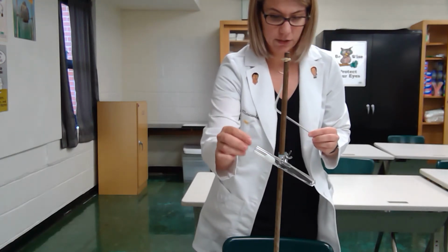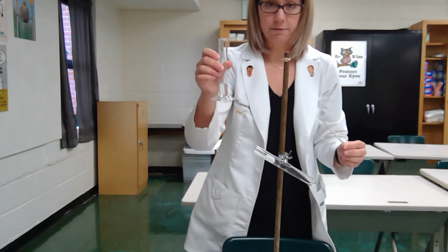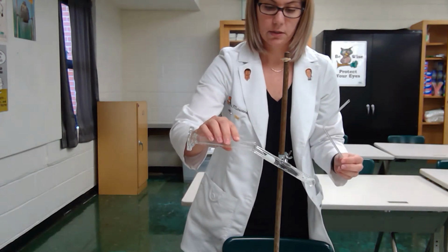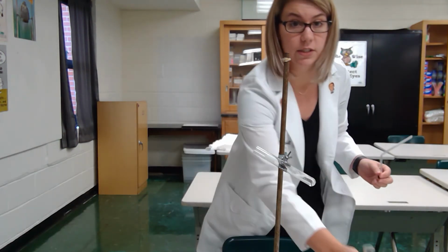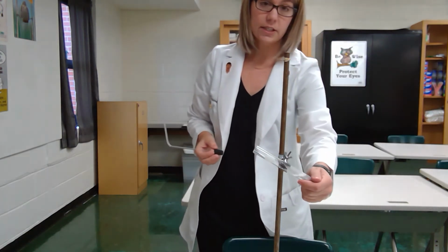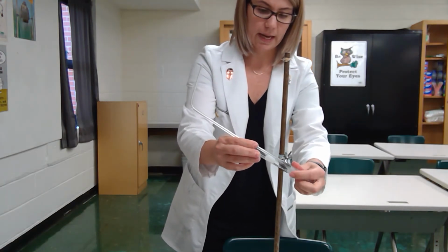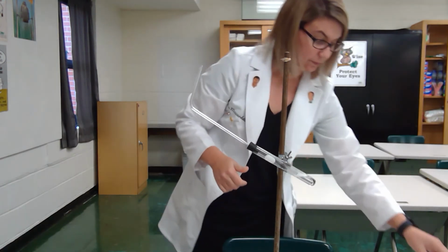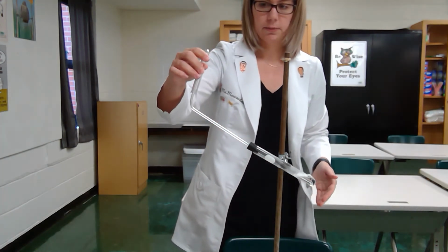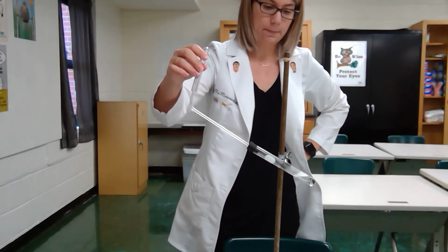So I'm going to go ahead and insert in my magnesium metal, and I have 5 milliliters of hydrochloric acid already poured out. So I'm going to mix those two, and you can start to see the reaction taking place. The test tube feels very warm. And I'm going to cap this. So this is reaction 1 for station 1 taking place. I'm going to put this test tube over for my station 2.